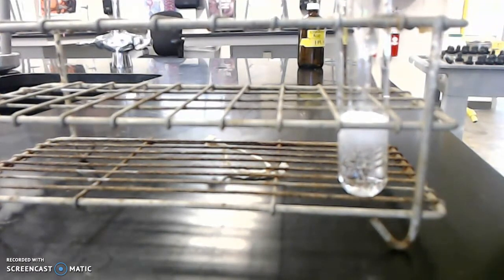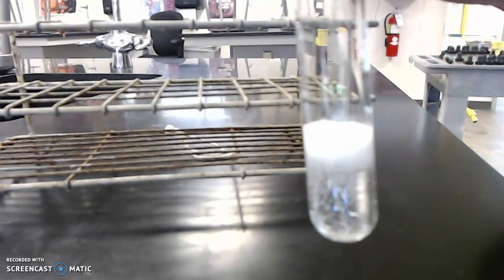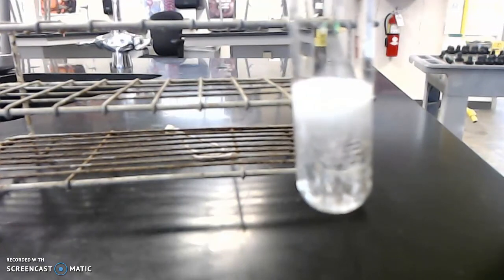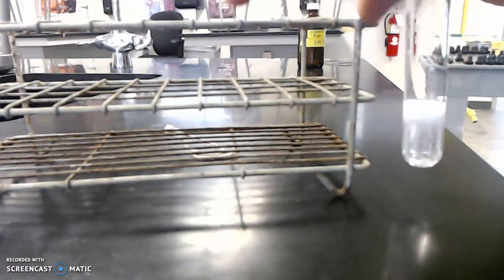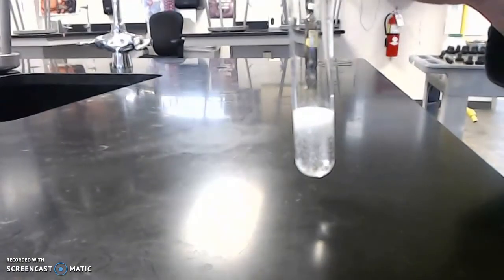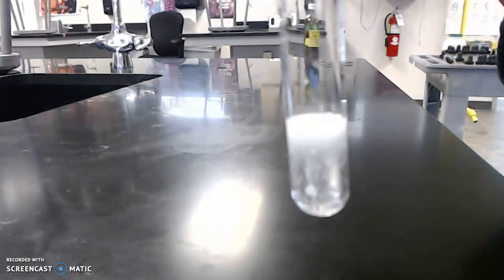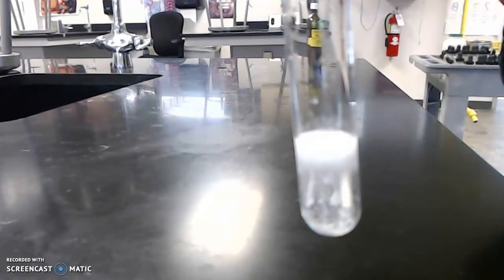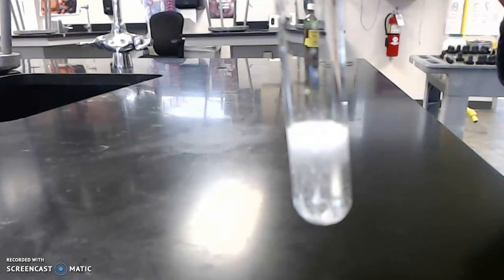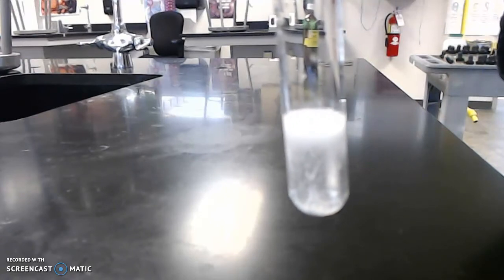and I'm actually going to show you what happens after the third part. So let's get this out of the way and bring this in, do an extreme close-up. And extreme close-ups do not work that well. So there is our test tube, and you can see some of that white stuff is dropping to the bottom of the test tube. That's actually really cool. I could watch this for another 5 minutes.